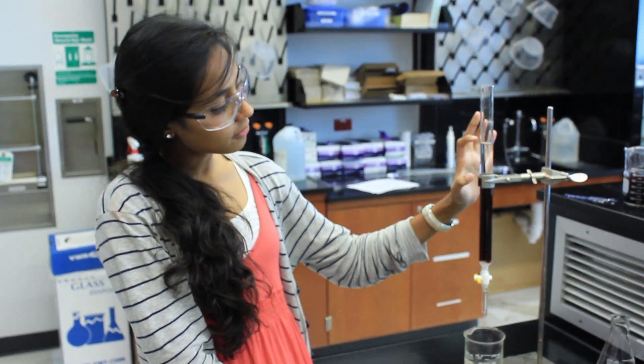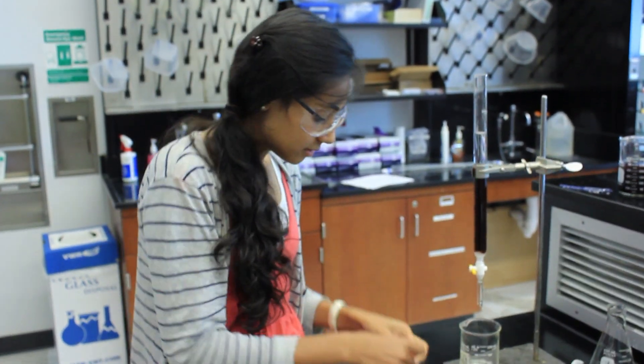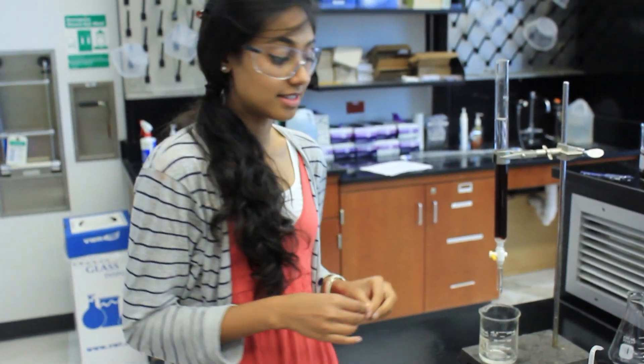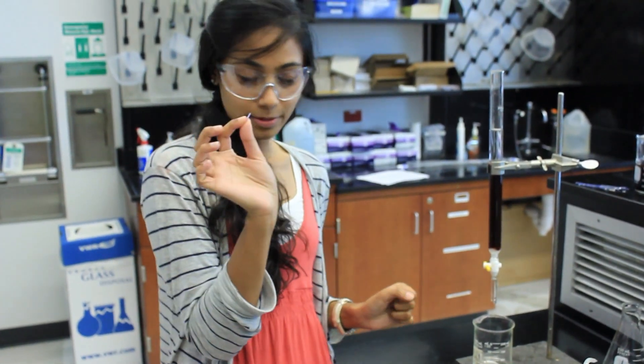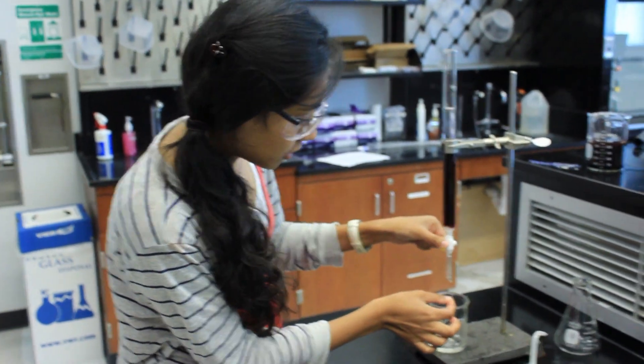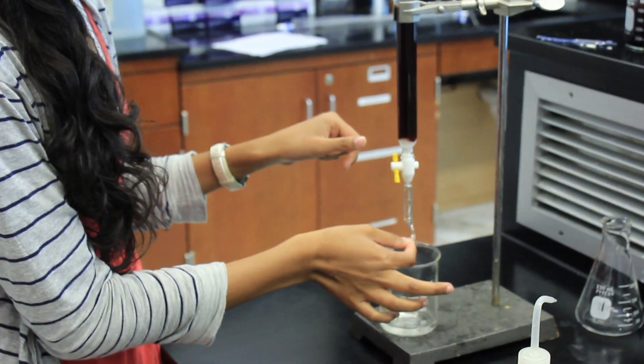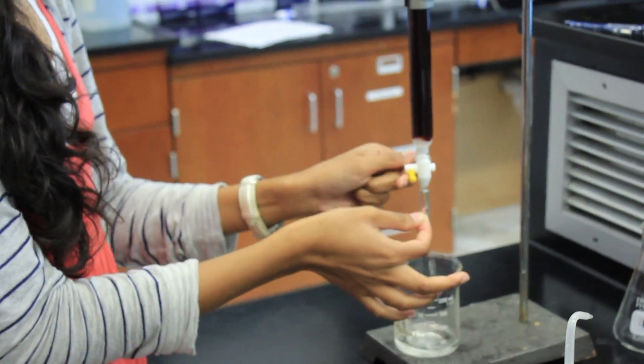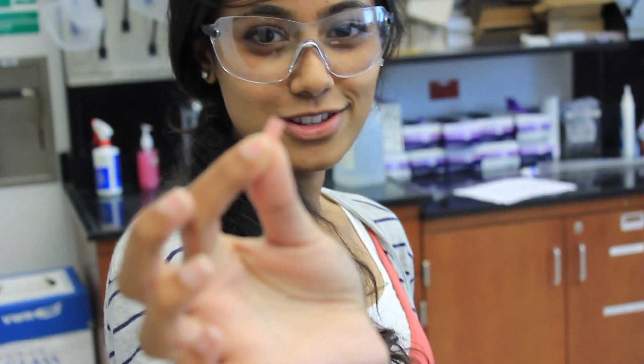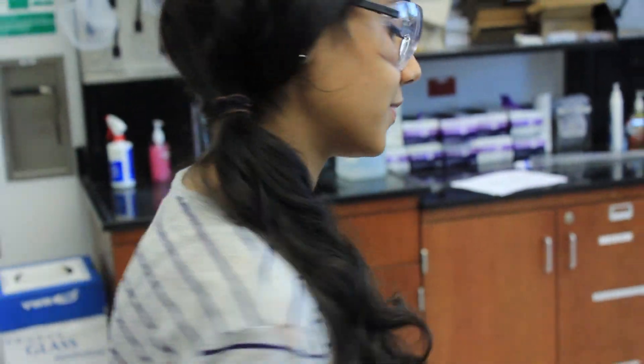There's a good amount of water on top. For now we have to make sure that the resin is acidic. You do this by taking a little piece of litmus paper and opening the stopcock slightly and making sure the paper turns red. If it looks like that, your resin slurry is acidic.